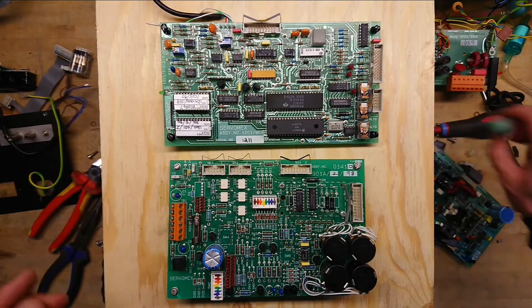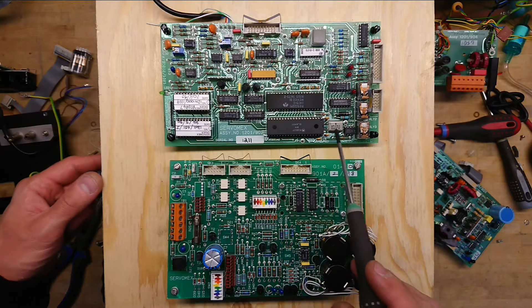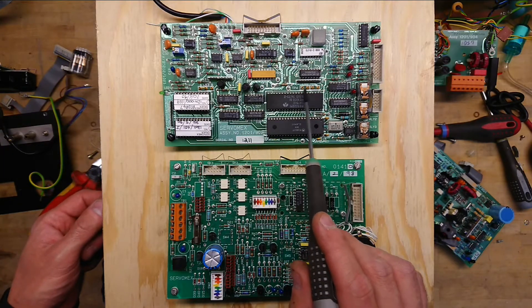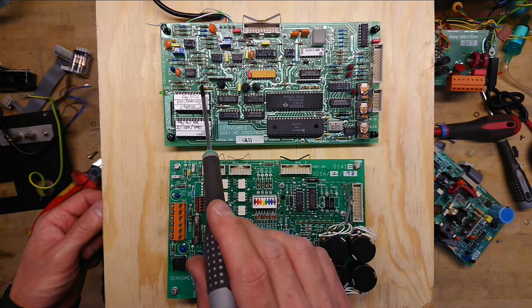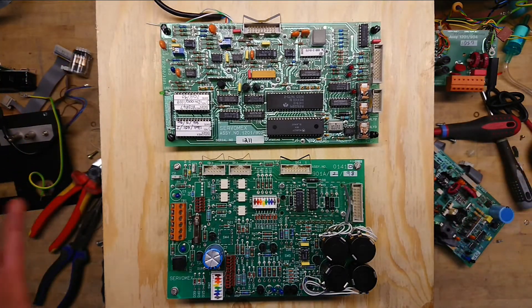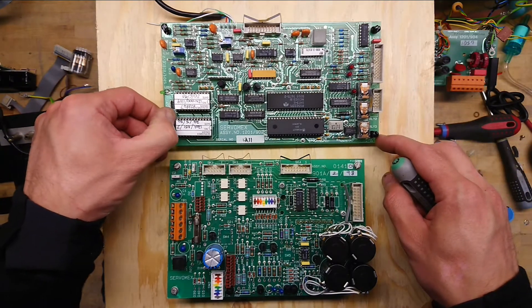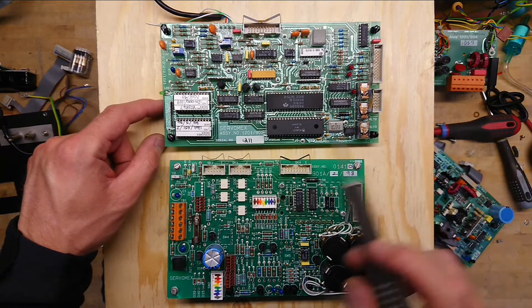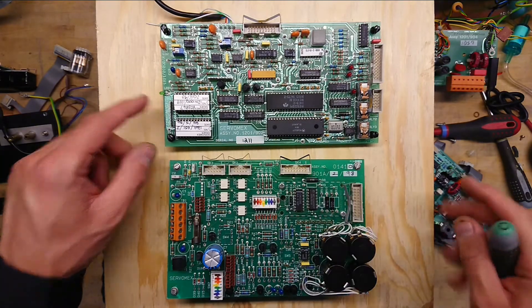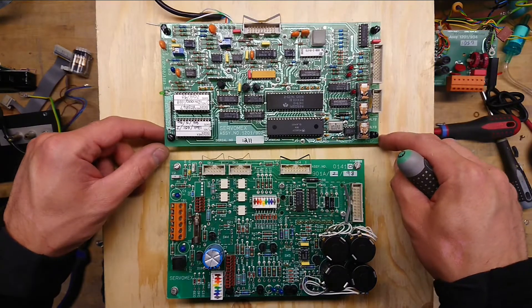The main CPU board with the MC6802 CPU running at 4 MHz — do we have anything worth noticing here? This is probably an interface driver chip. We have a few very nice gold-plated test points, and nice through-hole big sockets which you can actually insert a little gold bridge into. This is perhaps extremely much higher quality than the instrument appears to be. Certainly I hope this was expensive, because it seems to be expensively built. Over here we have the EEPROMs with the programs on. It has plastic packages, the really weird brown plastic packages, along with ceramic packages — so this is really built in between ages of different technologies.